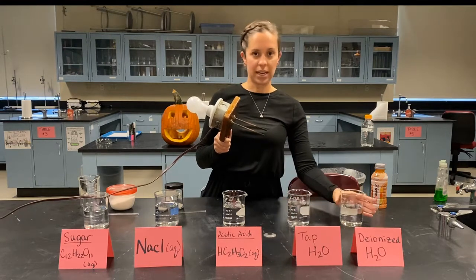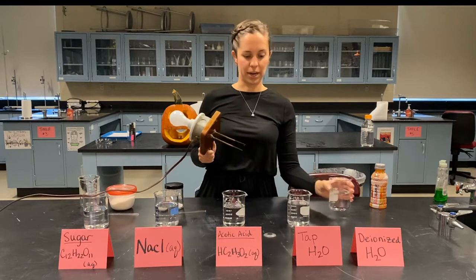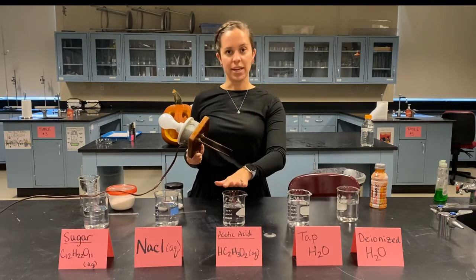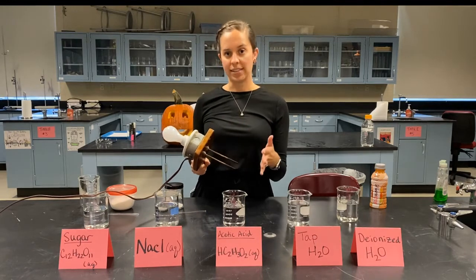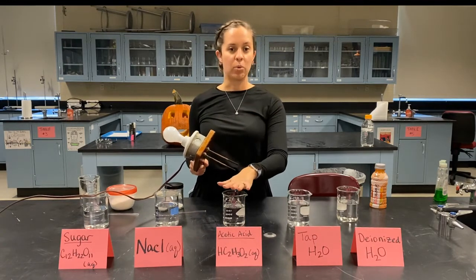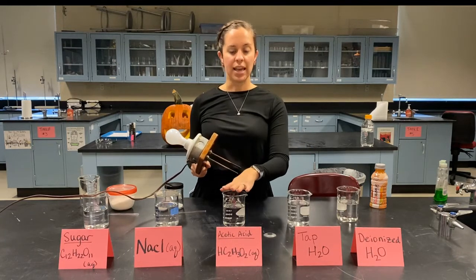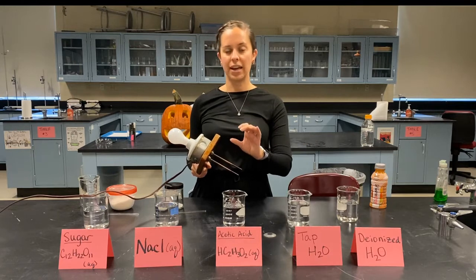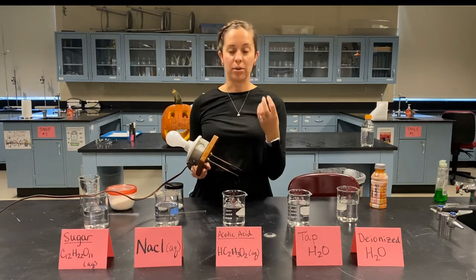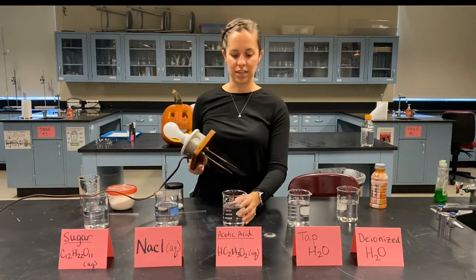Okay. Now I'm going to use my deionized water for now just as a rinser, to make sure I'm not contaminating my solutions. Next up I have acetic acid, and acetic acid is a weak acid, which we'll talk more about later, but weak acids are also weak electrolytes. What happens is some of the acid molecules separate into hydrogens and the anion, but others stay together and are molecular and do not separate, so therefore they cannot conduct electricity.